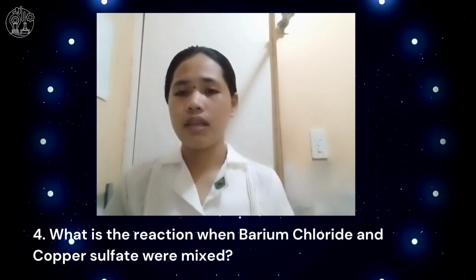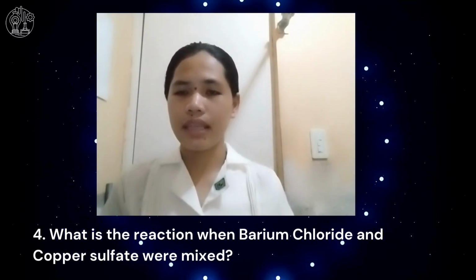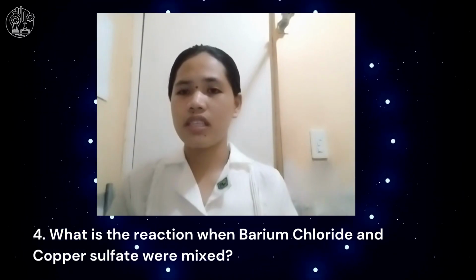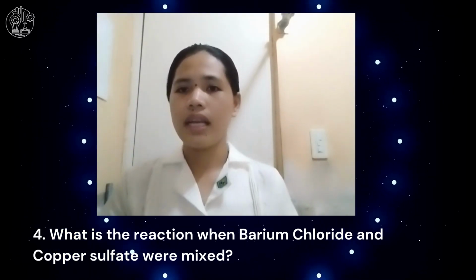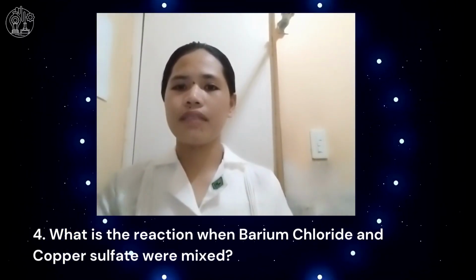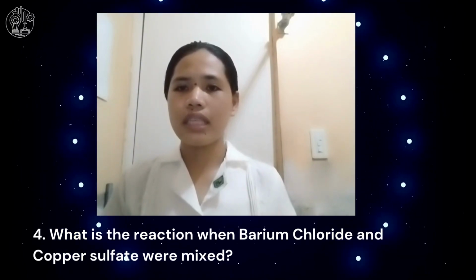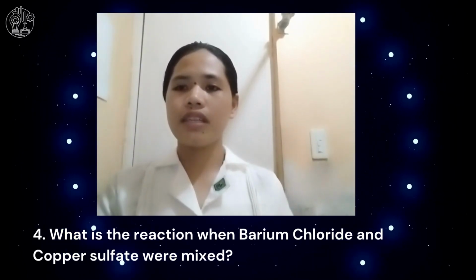Question number 4. What is the reaction when barium chloride and copper sulfate are mixed? Barium chloride plus copper sulfate is equal to barium sulfate plus copper chloride. The resulting barium sulfate from the reaction has low solubility in water, causing it to form a solid precipitate that is frequently observed as a white sediment.